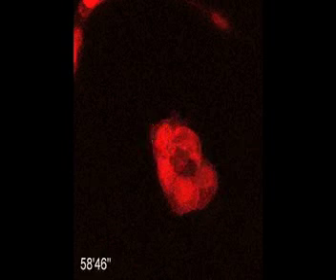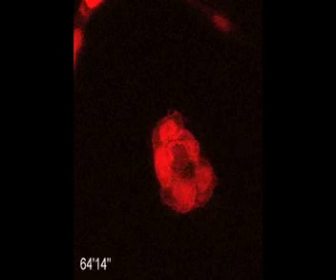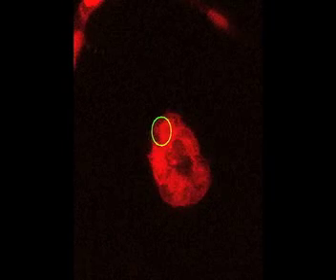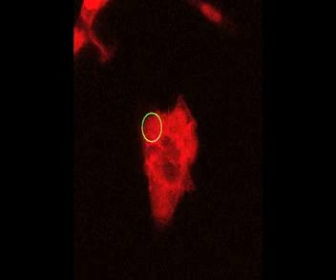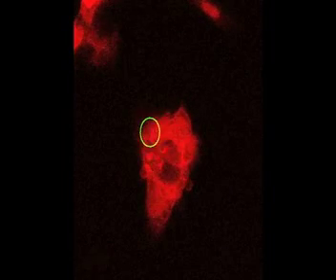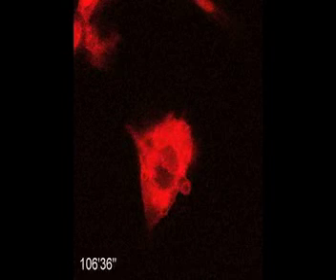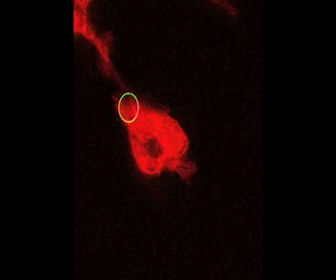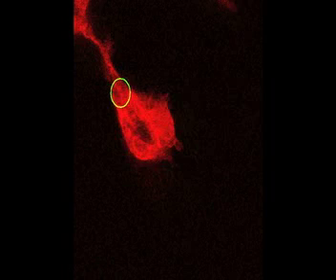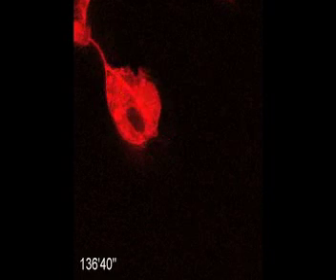And then he stops illuminating the front and now starts illuminating the back. The cells realize something's different. Just about instantly, the cells stop protruding at the front. And we can see fairly rapidly some protrusion at the back, but you don't get backward movement until after a delay. We think that what's happening is that the cluster is initially polarized, and the front cell knows that it's different from the back. Now we start illuminating at the back, and it takes some time for each cell to adjust to its new identity in order for the whole cluster to move backwards.